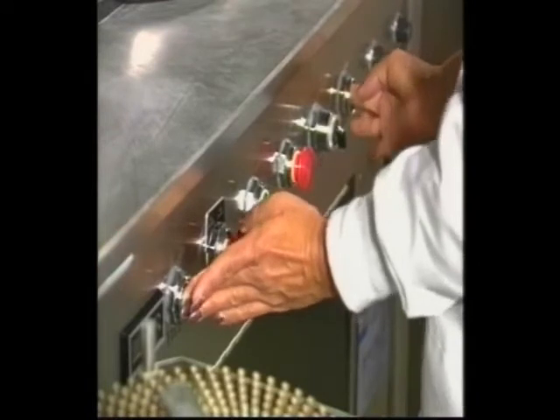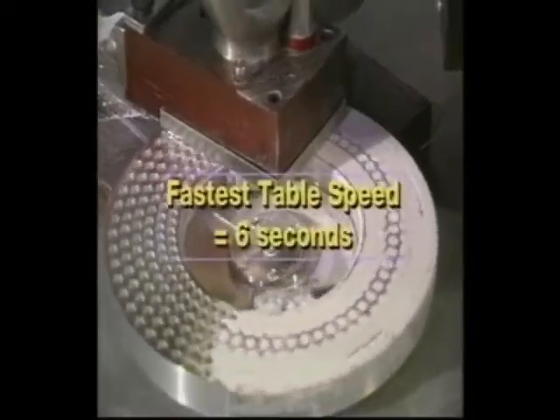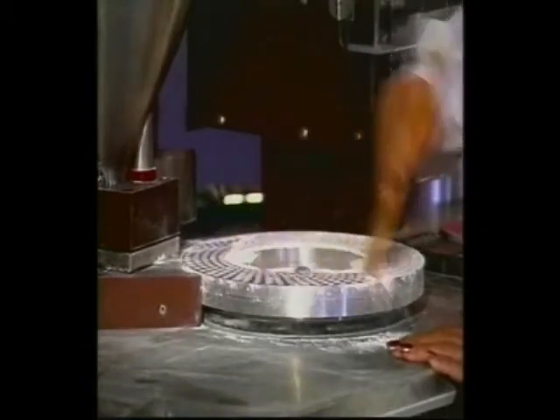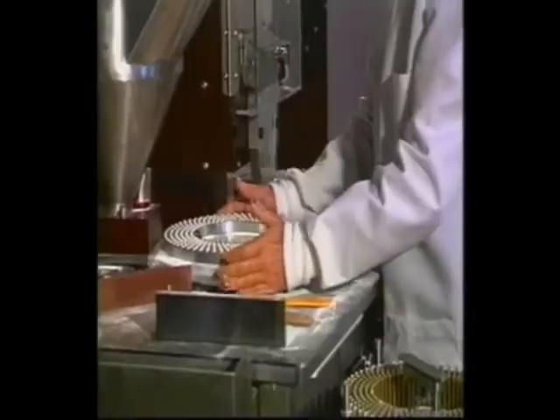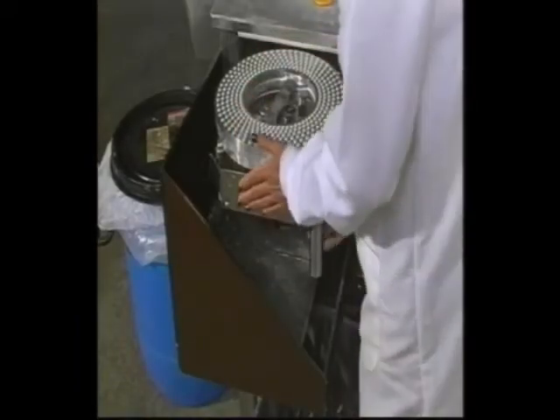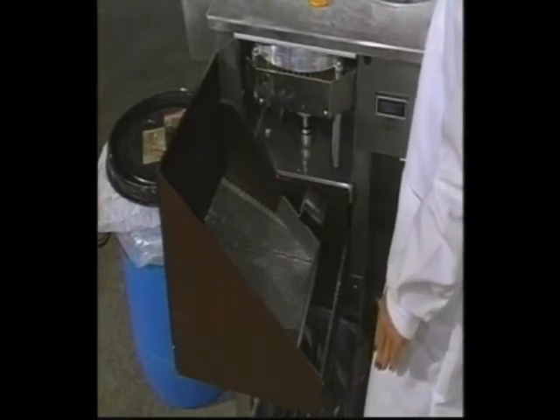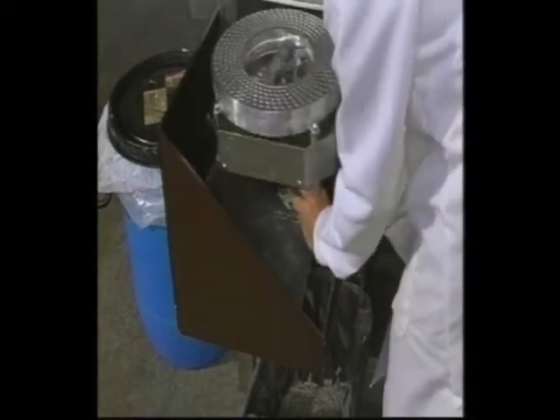To start the filling process, press both fill buttons simultaneously. The powder hopper will swing over to fill one complete ring of capsules before it stops. At its fastest, the filling table will fill your capsules with product in about 6 seconds. When filling is complete, clear the extra powder off the ring and rejoin it with the cap ring. Your last step is to close the capsules — secure the rejoined ring on the closing station's peg ring, lock it into position, and push the closing station into the machine. Air pressure will close the capsules. When complete, pull the closing station out and eject the capsules by dumping them over the dust screen and skag box into the capsule holding bin.